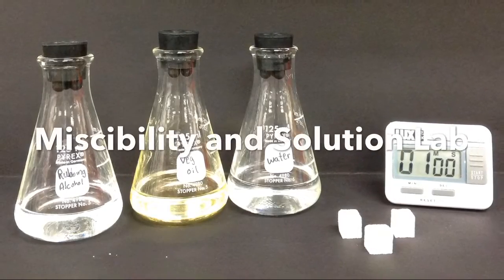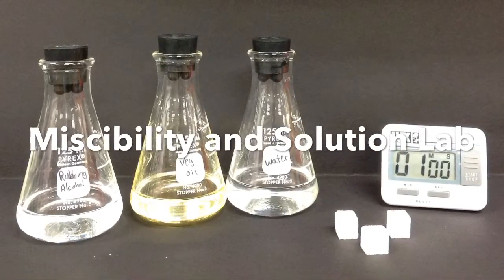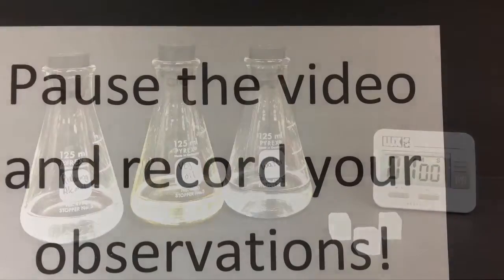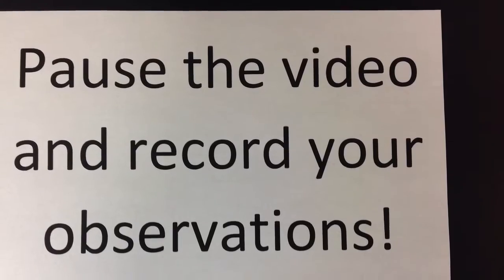This is your miscibility and solutions lab. Take a look at the three liquids. You'll be writing down your observations in a moment. Pause here and write down what you observed.